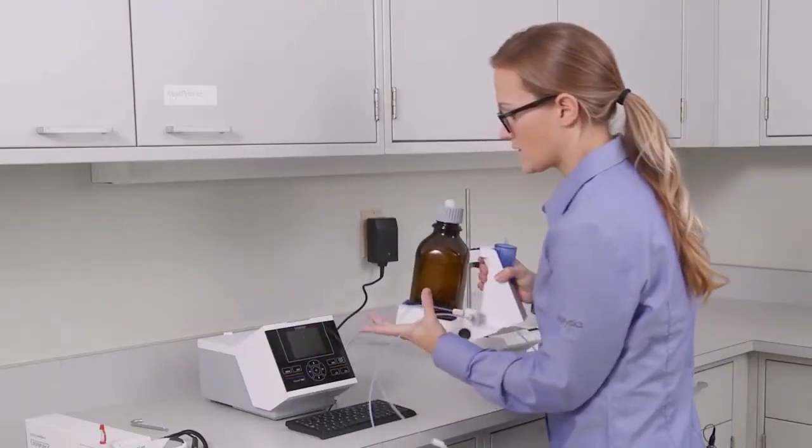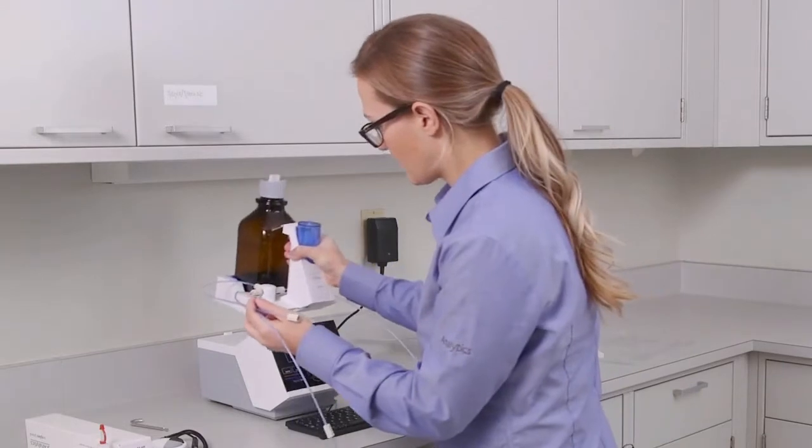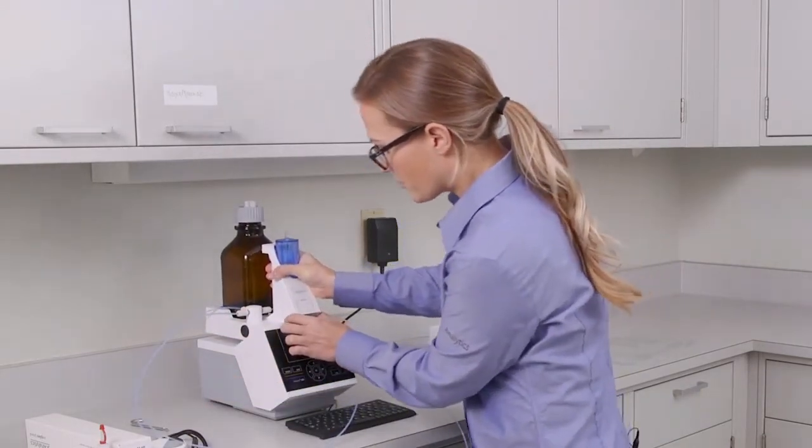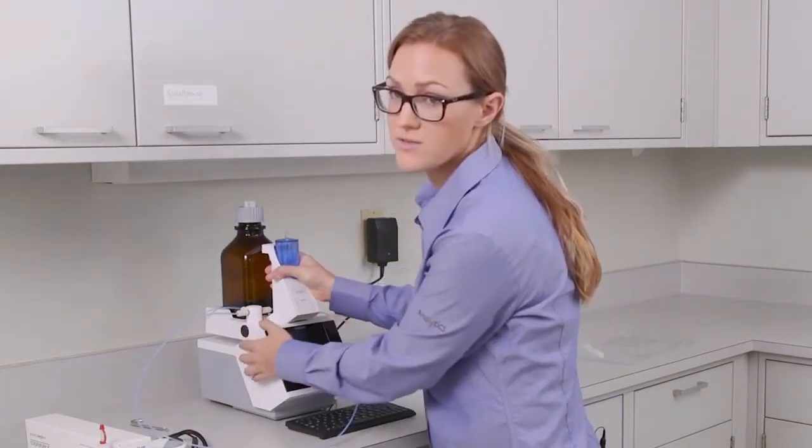And now you're ready to slide this onto the base unit. We'll line up the sides here and just push down at a 45 degree angle until you hear a click.